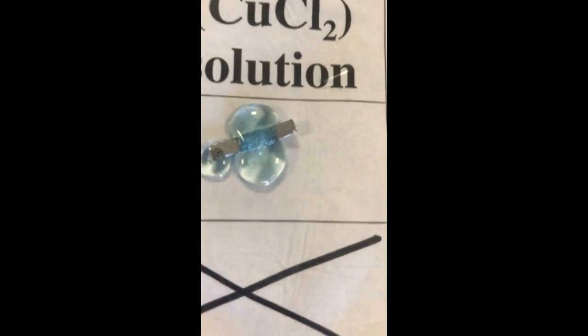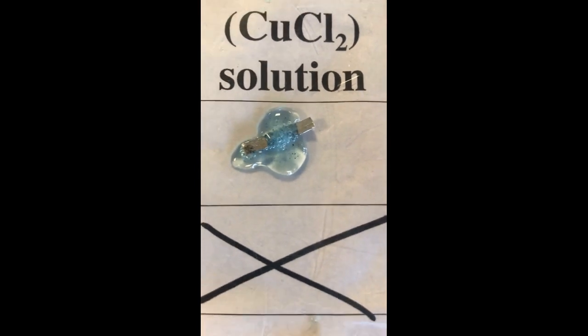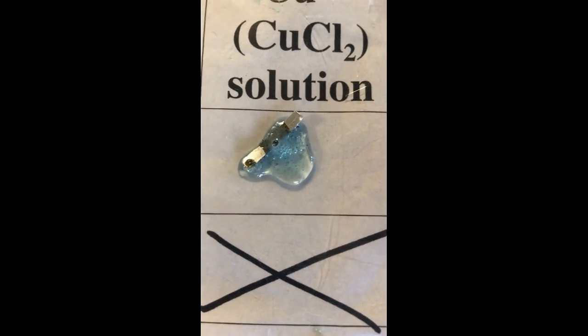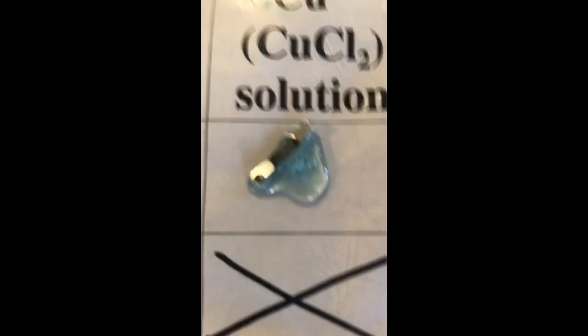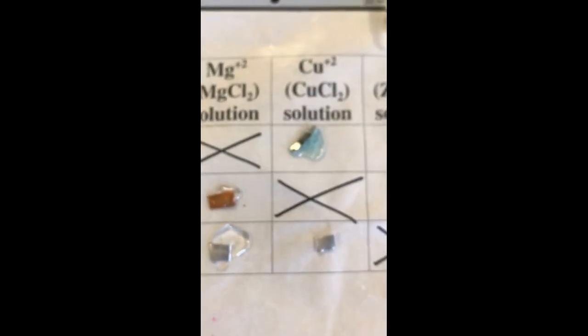Now, let us start dropping this CuCl2 solution on our magnesium strip. As you can see, we have bubbles. Liftoff. Beautiful. A chemical reaction.